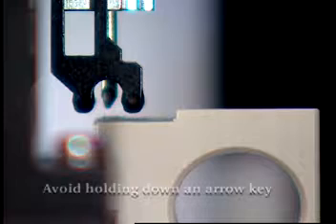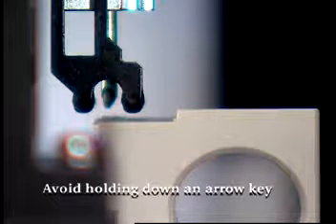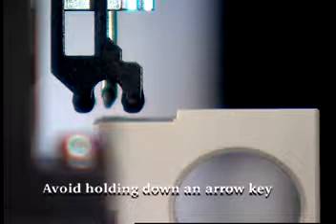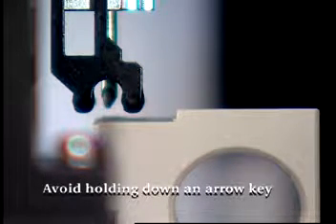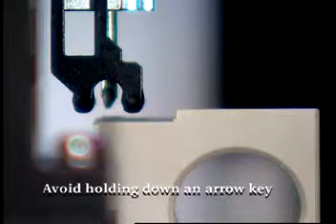It may be easier to use the keyboard arrow keys instead of clicking the on-screen buttons to adjust the needle position. This allows you to adjust the position without taking your eyes off the needle. Avoid holding down an arrow key. Doing so stores keystrokes and causes the needle to continue moving even after you release it.